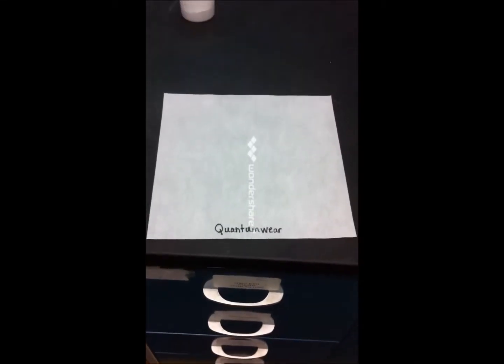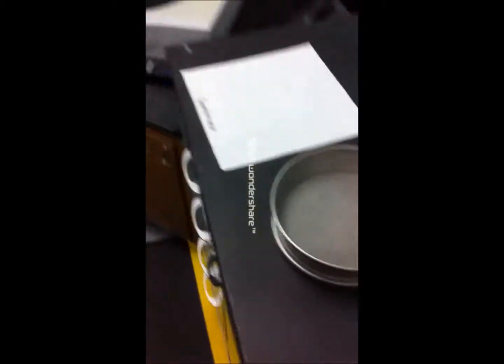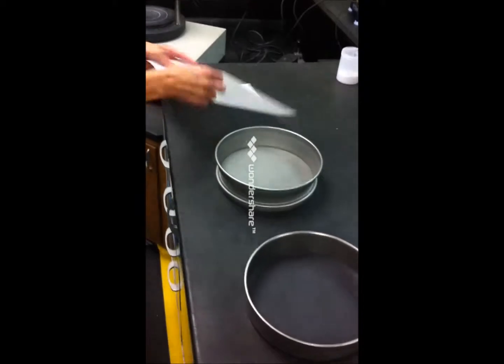Now we're going to do the particle filtration test with the quantum wear fabric using the same 25 grams of talc powder. So Terry, go ahead and load it up.